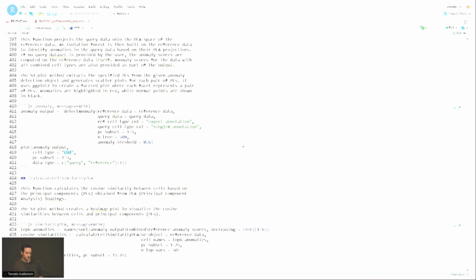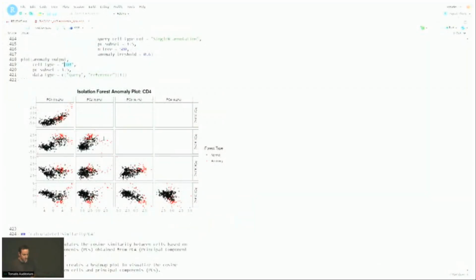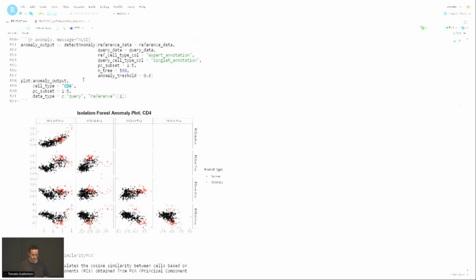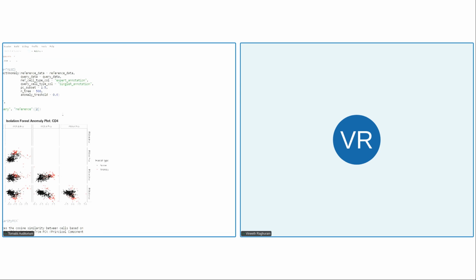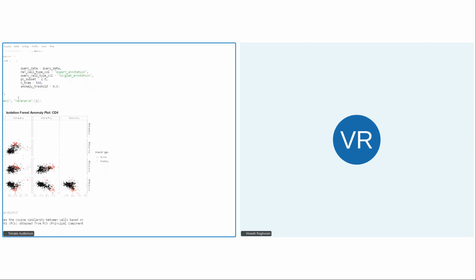So what I'm going to plot is, well, let me first generate the plot. So we're going to plot the query data, and then specifically for CD4. So we're going to plot the query CD4 cells, and there will be two colors, black and red. There we go. So the red cell types here are marked as anomalous based on the isolation forest that was trained on the reference, right? And then we can also plot it for the reference if you want. So this is just one particular example that can be used.